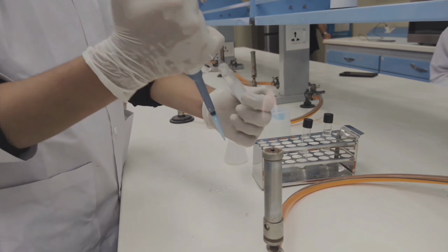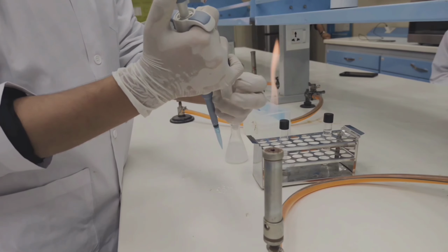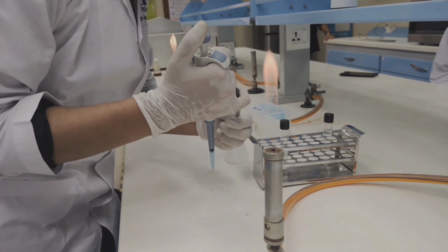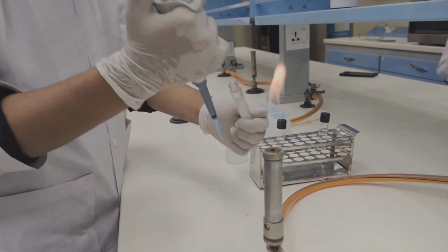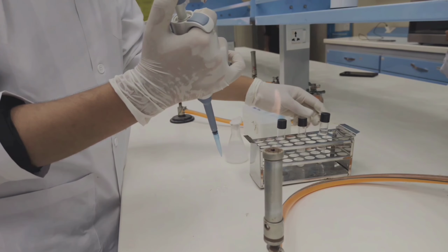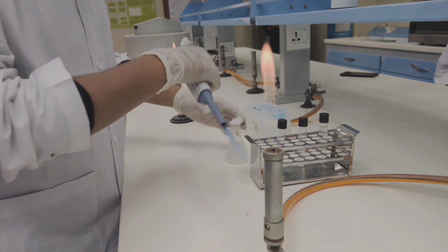Now we have to take 1 ml of solution from that test tube and then inoculate in a third test tube. Then by this method 3 dilutions are formed. Now for fourth dilution, again we have to inoculate a sample from the last test tube to another test tube. By this way 4 dilutions are formed, and by this the whole step is completed.